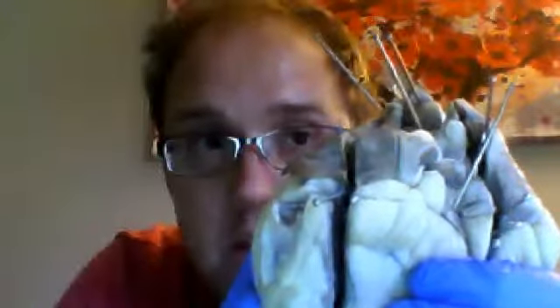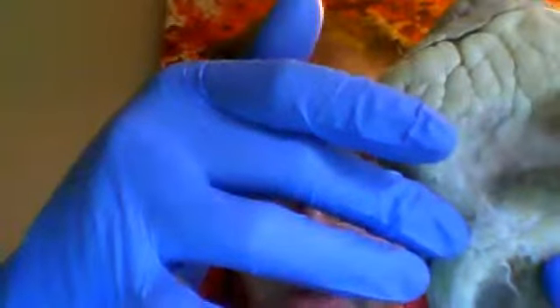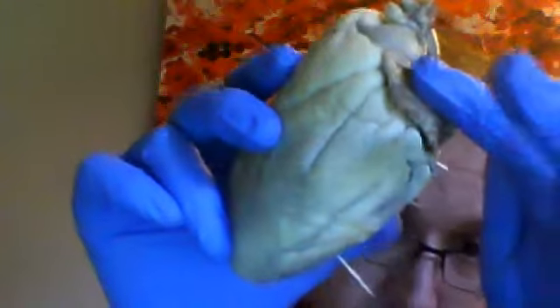Okay, so on top of each of the atria, you have the auricles. The auricles essentially are reservoirs for blood that send blood down to the ventricles on their respective sides. So you have the right auricle here that sends blood to the right ventricle down here, and that blood is going to be deoxygenated. And you have the left auricle that sends oxygenated blood down to the left ventricle.